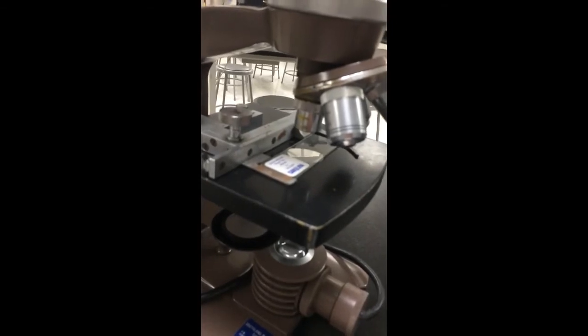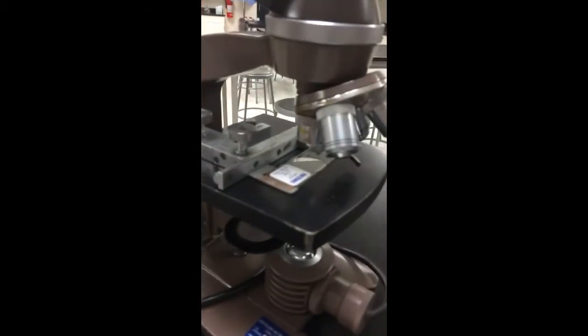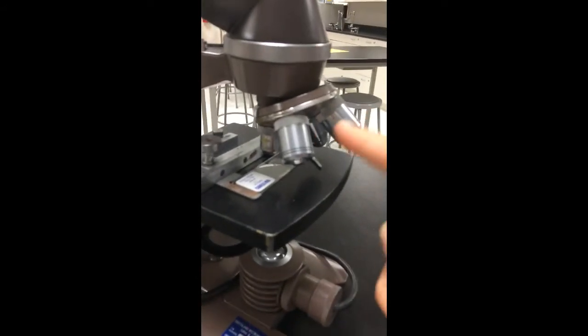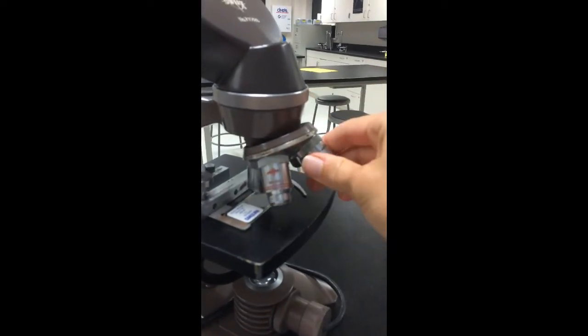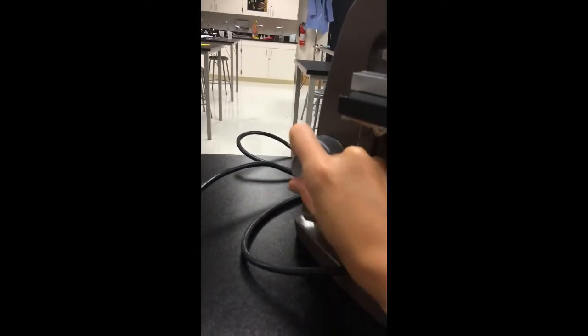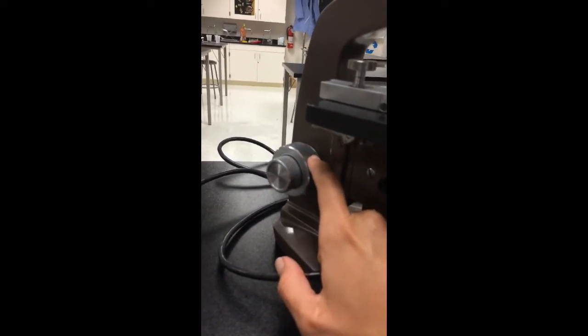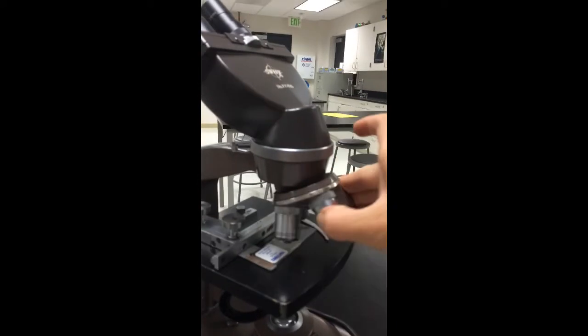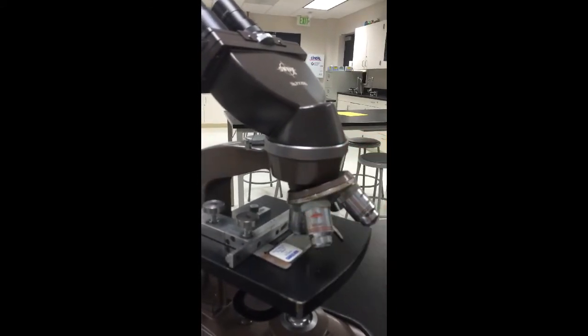So again, looking at the microscope here, right now it's on the lowest power objective. Once I focus it using the coarse and fine adjustment knobs, then I can rotate the nose piece so that the next highest powered one clicks into place. And you can kind of feel it move into position there. I will only then use the fine adjustment knob, or the smaller of the two, to make little changes to adjust it. And if I ever lose focus, I can always pop it right back to the lowest power objective, refocus it, find it, and then move it back up to the next higher one again.